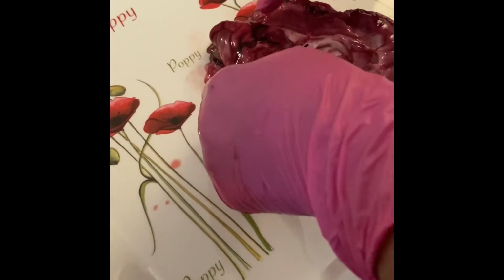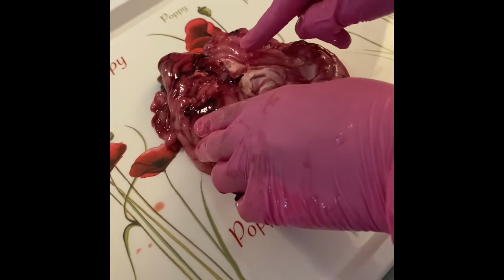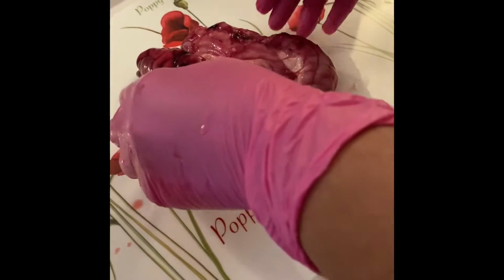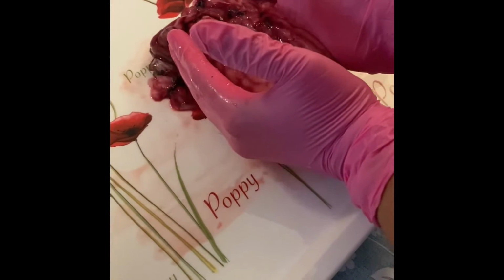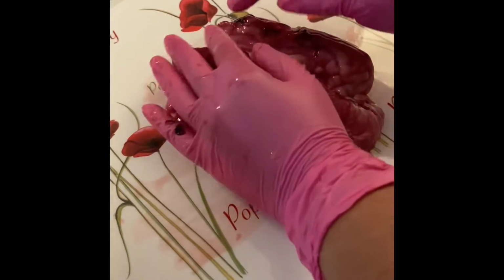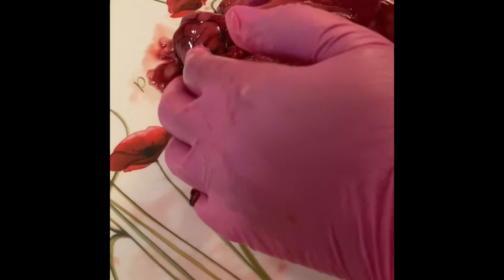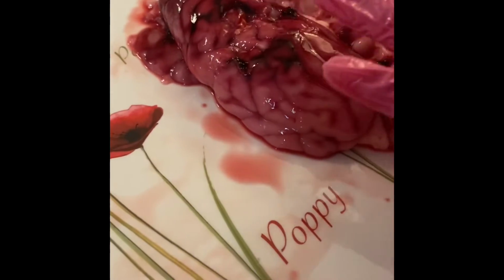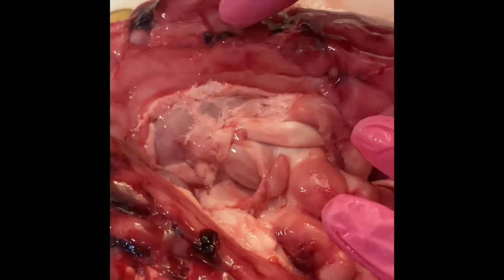The space between the two hemispheres is called the longitudinal fissure. What is it called? The longitudinal fissure. And then if we open it and we see this, so these dark things, I think this is coagulated blood, and you can see some blood clots here. Can you bring the camera closer here? Do you see these dark things? These are blood clots.